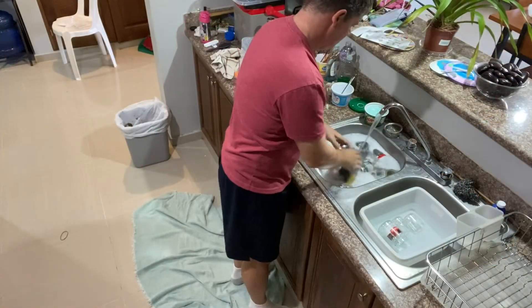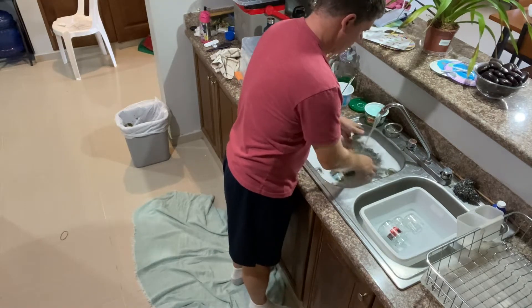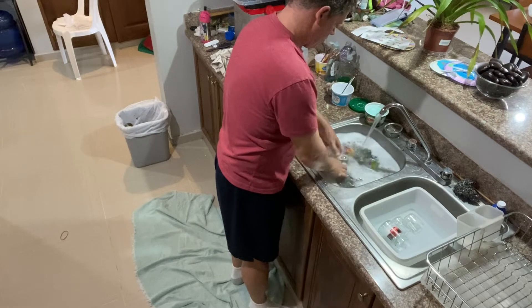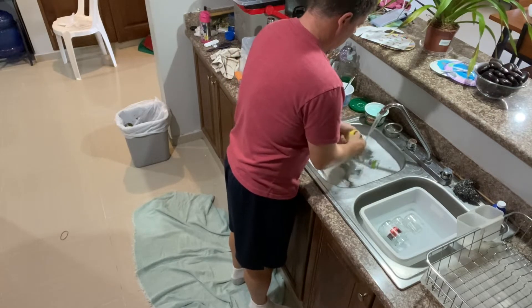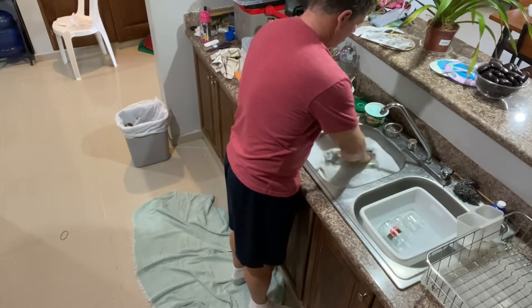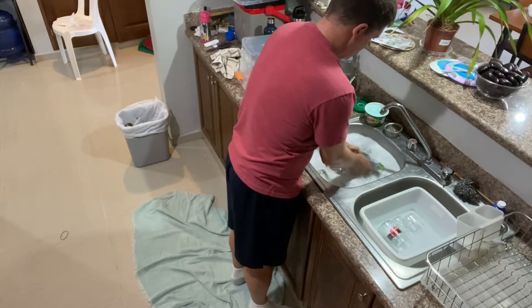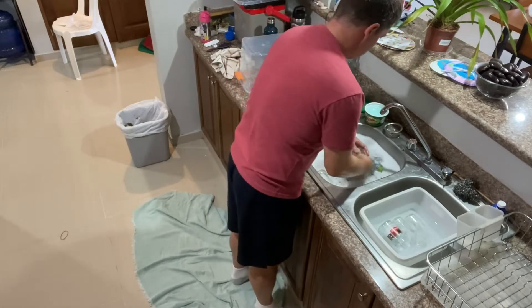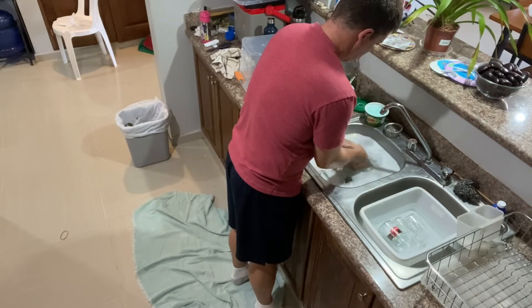The first thing I did was wash all of the glass jars with a little bit of bleach. Glass seems to be the best material to use and they have to be small enough to fit in the pressure cooker. The cleaning of the lids is super important because the biggest problem with this whole process is contamination of the flasking media. You have to make sure that you clean the lids really well, scrub the insides and outsides, and just make sure that everything is super clean.